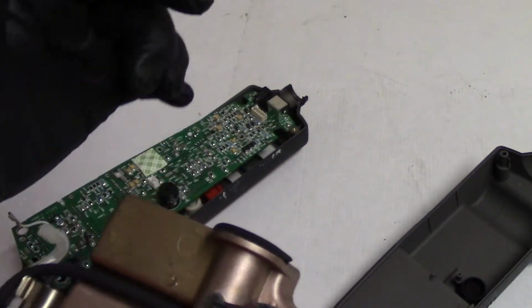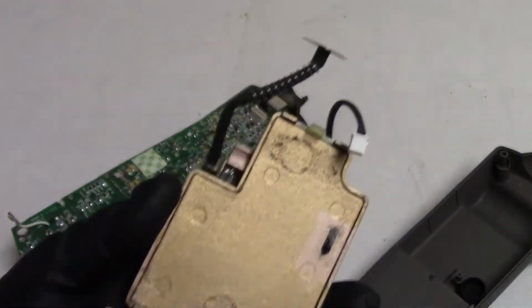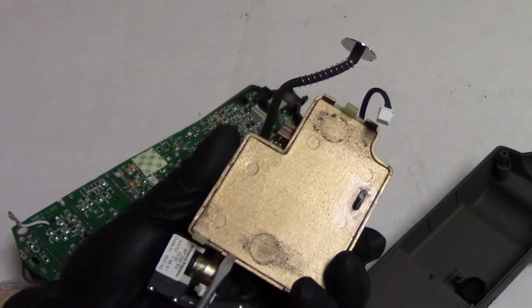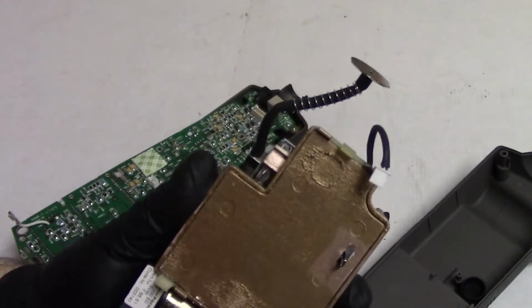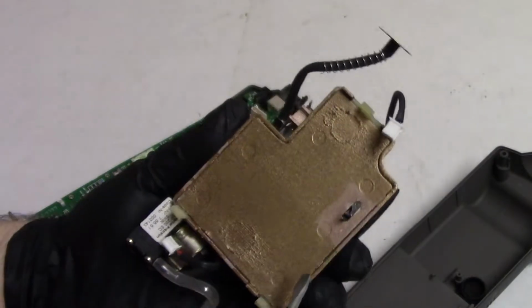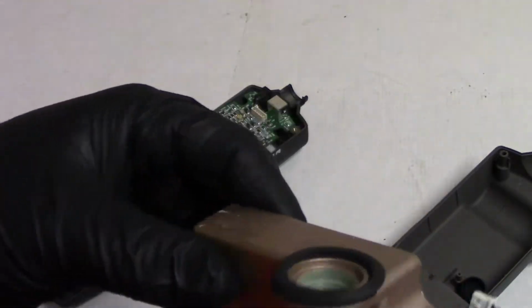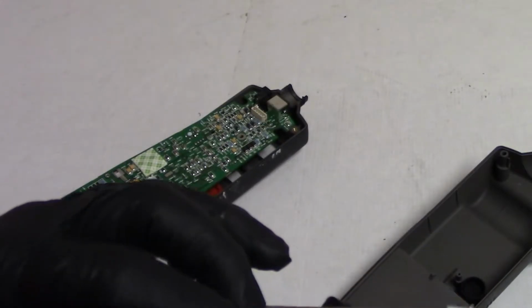Doesn't feel like it. I don't know why that would be so heavy. Let's see, does this open at all? No. I think there just might be something in here. It doesn't want to open. There might be a transformer in there. I don't want to wreck this thing. I want to be able to keep using it.